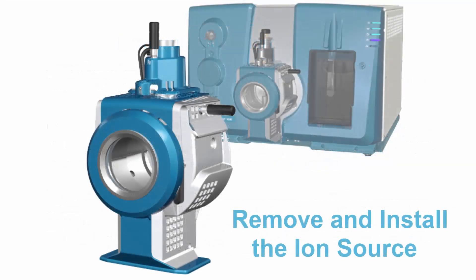This video will show you how to remove and install the ion source onto the mass spectrometer.